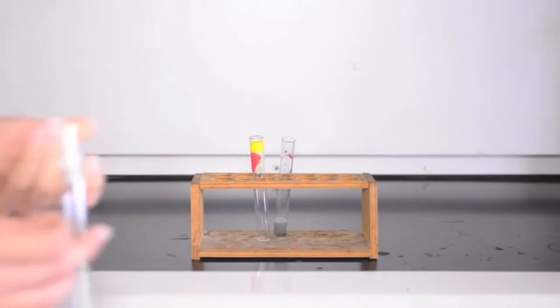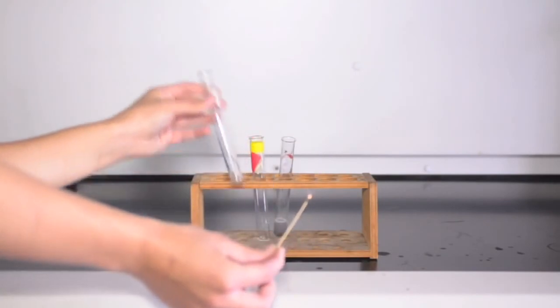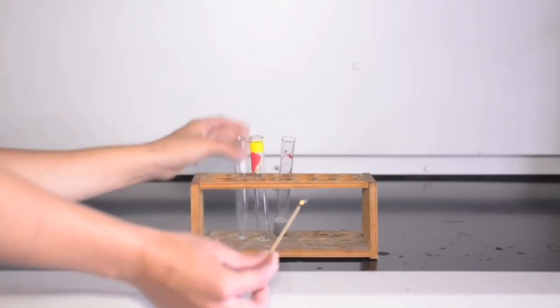The sounds you hear will either be very loud and sharp, or it could be a low pop. In any case, the sound would be a positive test for the presence of hydrogen.